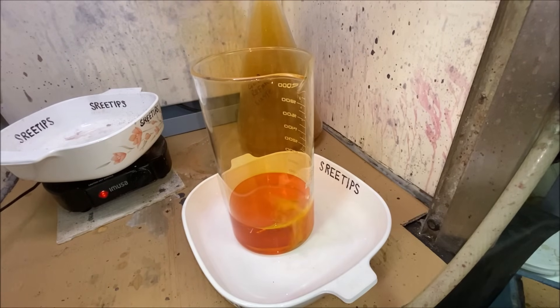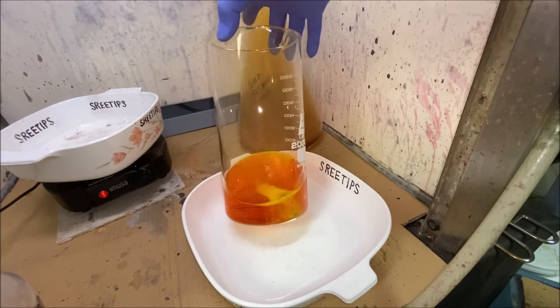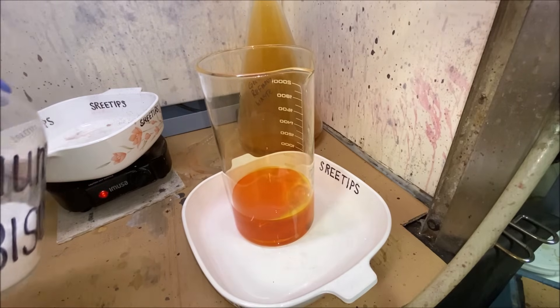This is definitely due to excess nitric in this gold — everything went right back into solution. Luckily I had the camera rolling and I pulled it off the heat just in time, just before it went into a full boil-over. I'm going to add just a touch of SMB and see what happens.